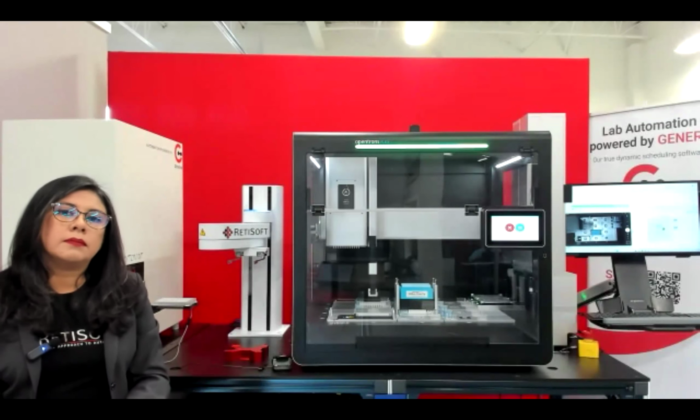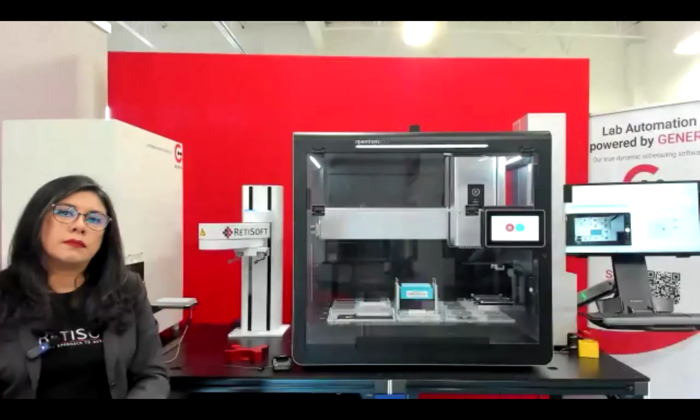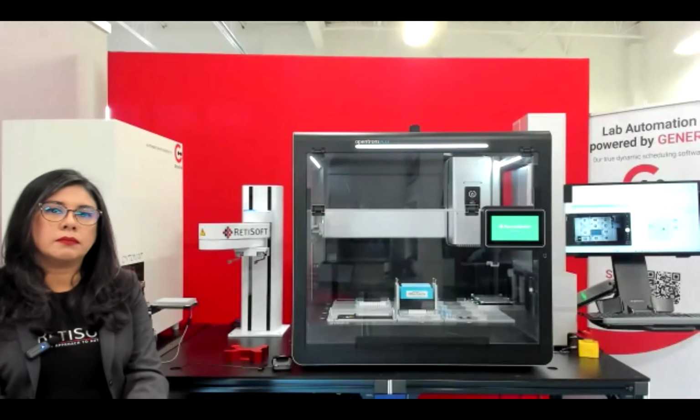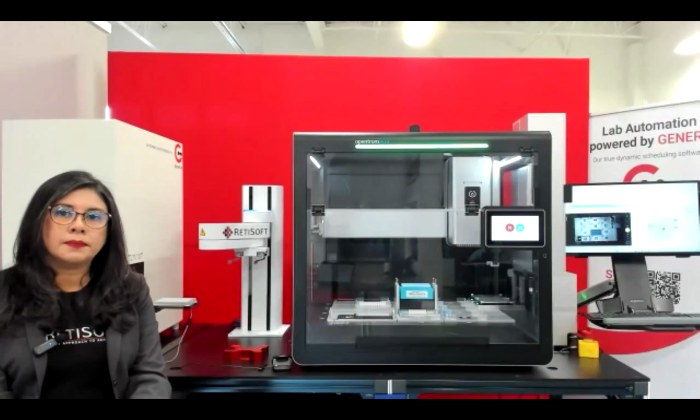So let's say they're doing something that requires specific incubation times. You could have the incubation time be a variable, have that go through your LLM, and then send the output to the Genera process. That's more indirect, but I would say that's the main way that AI has been used with Genera to close the loop.